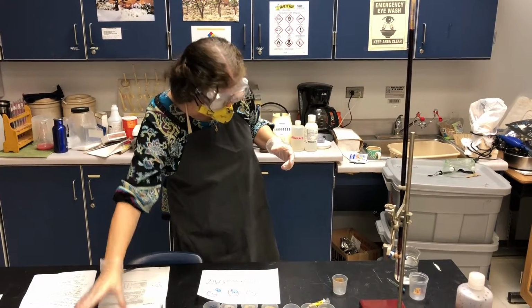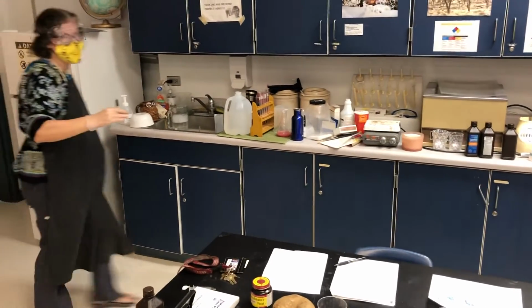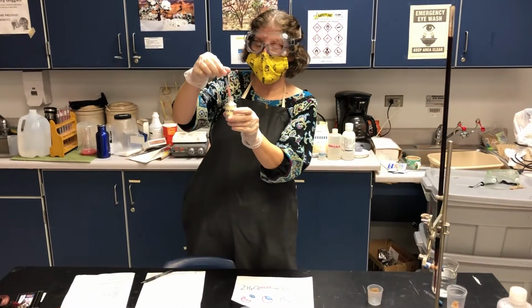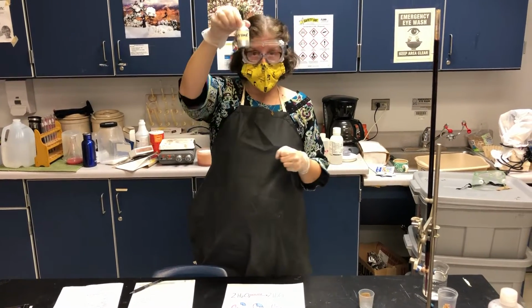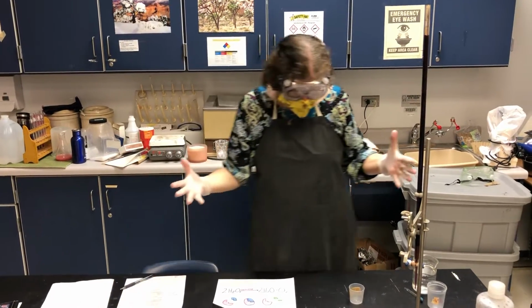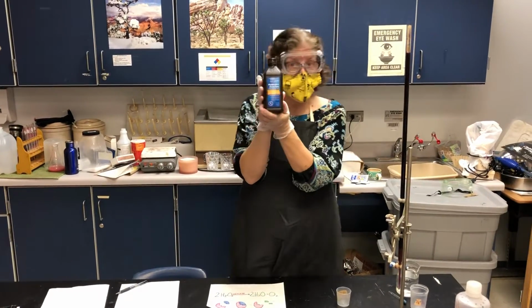And in fact, that is what we were going to be using. We are going to be using catalase enzyme that is now in here. That is from liver extract. I put some of that liver in the blender and mixed it with cold water and sieved it out, and now we have our enzyme, catalase, right in there. The substrate that we're going to be using is hydrogen peroxide, which you can buy at the store, and you probably have some at home right now.